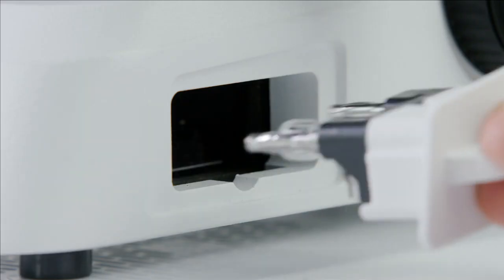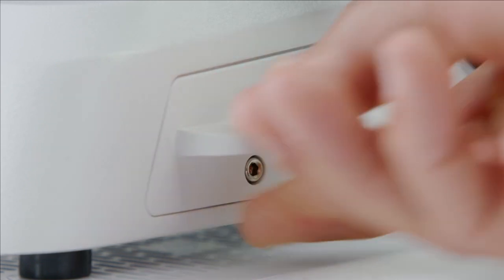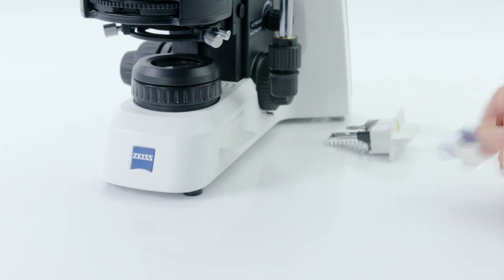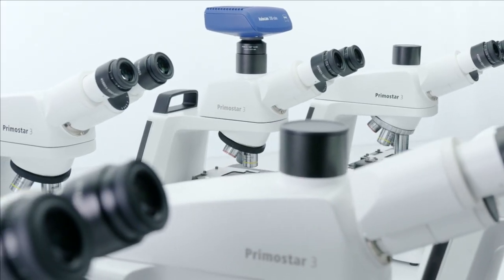Now simply replace that with your preferred illumination insert. There's only one position that works, so you can't go wrong. And finally, just tighten the screw and you're good to go.